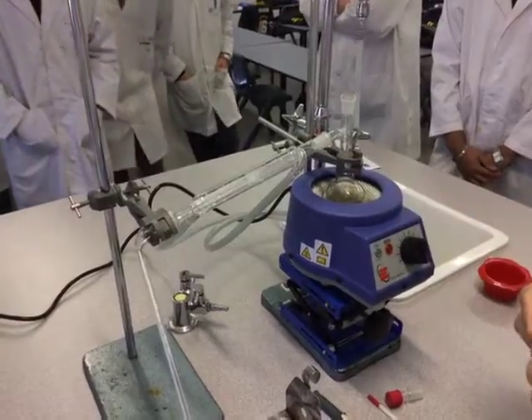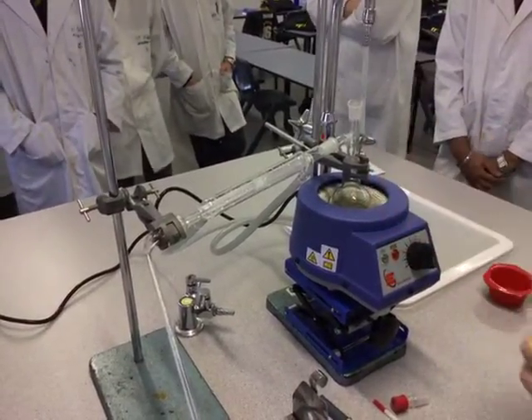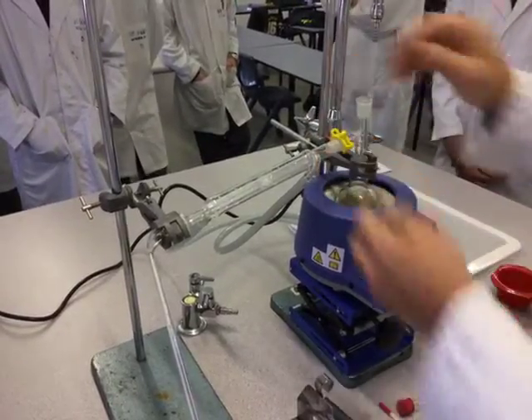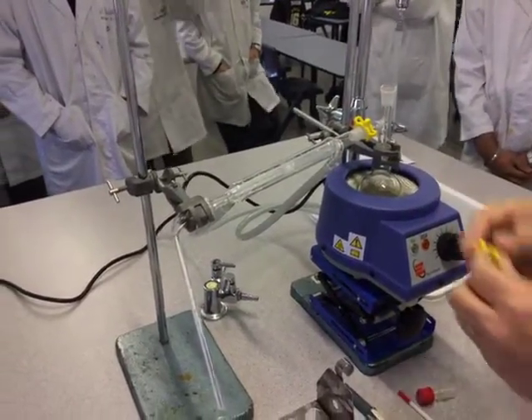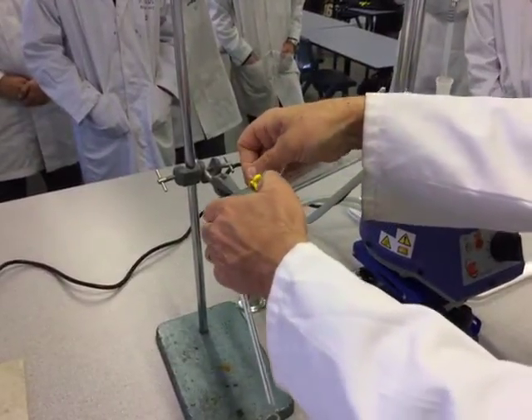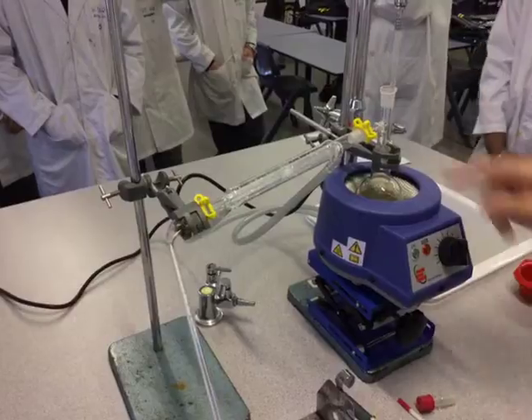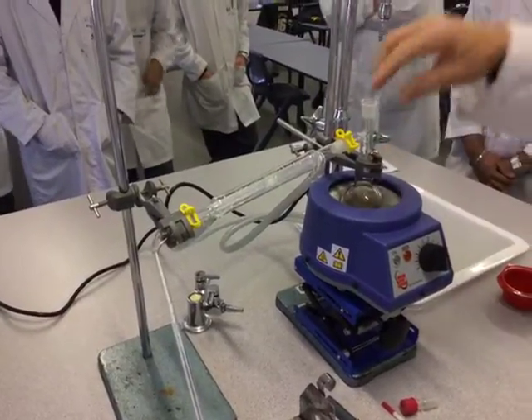We use these clips, and they're just an added measure that we have access to. These little clips just help us keep everything together should things get loose. We don't need one here for obvious reasons — gravity's doing its job.